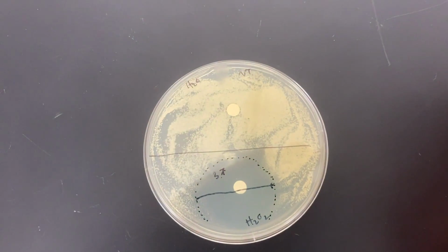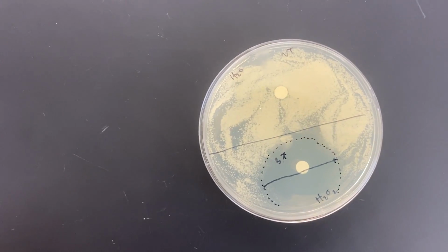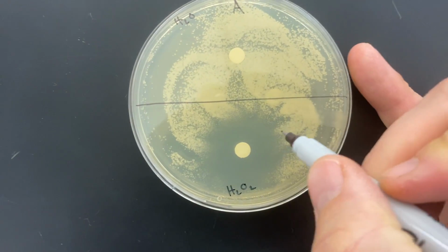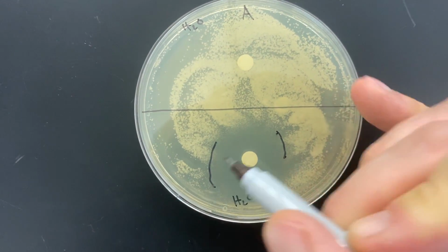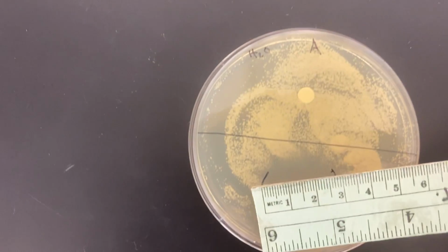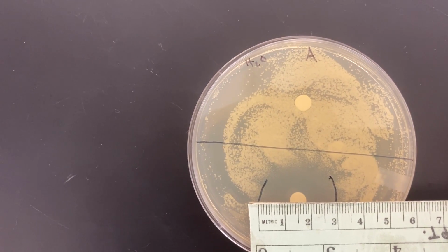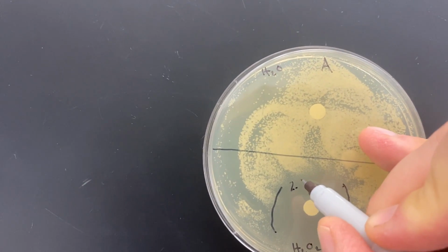And you can see it's basically a perfect circle. If you wanted to, you could take multiple measurements across that and compare them. Let me try to do this a little bit faster for these other ones. So through the center all the way from one point to the next, 2.9 centimeters diameter.